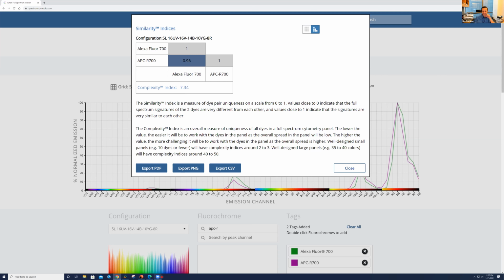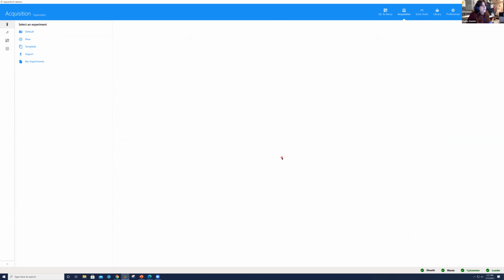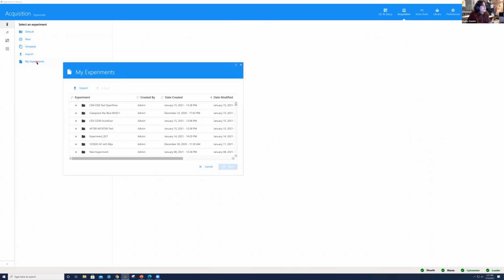Okay. So let's go ahead and go back into the software then. Taking into account, we see that we do have a combination of fluorochromes that has a much higher similarity index, right? 0.96. It's getting a lot closer to that value of 1. So I'm going to close out of this experiment. I'm not going to save these changes. And we're going to take a look at the example of the Alexa 700 and APCR 700, which we have already run at this instrument.